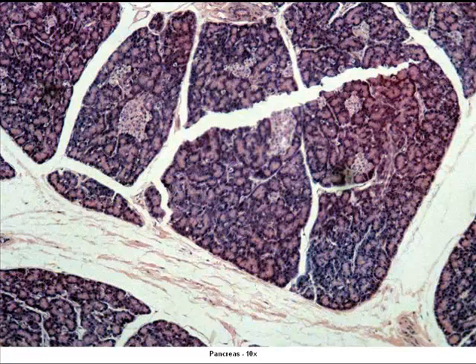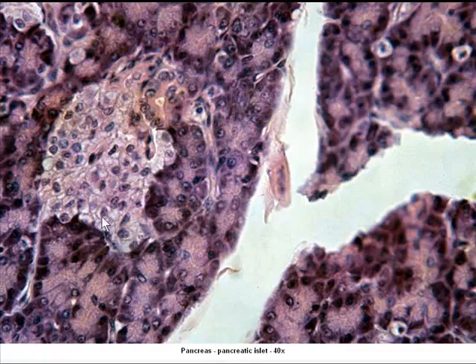At the time when we were looking at it for digestive system, we were focusing on the pancreatic acini, all of these cells out here that are putting out the pancreatic enzymes. Now we're focusing on these bleached out areas that we see here, known as the pancreatic islets. These pancreatic islets, and again here's a zoomed up version of one right here, put out various hormones. You need to know the hormones and you need to know the cells that produce them. So beta cells putting out insulin and then what insulin does, alpha cells putting out glucagon, and delta cells or D cells putting out somatostatin.